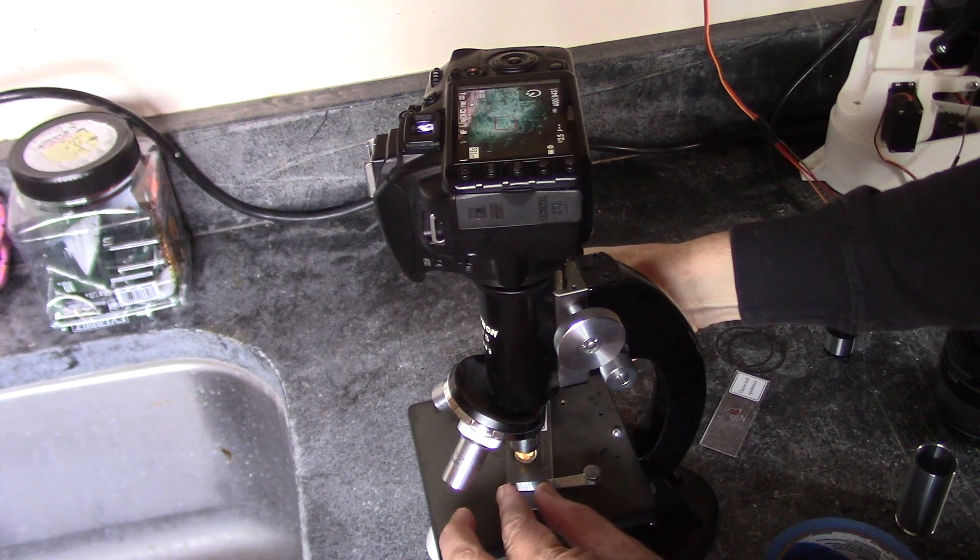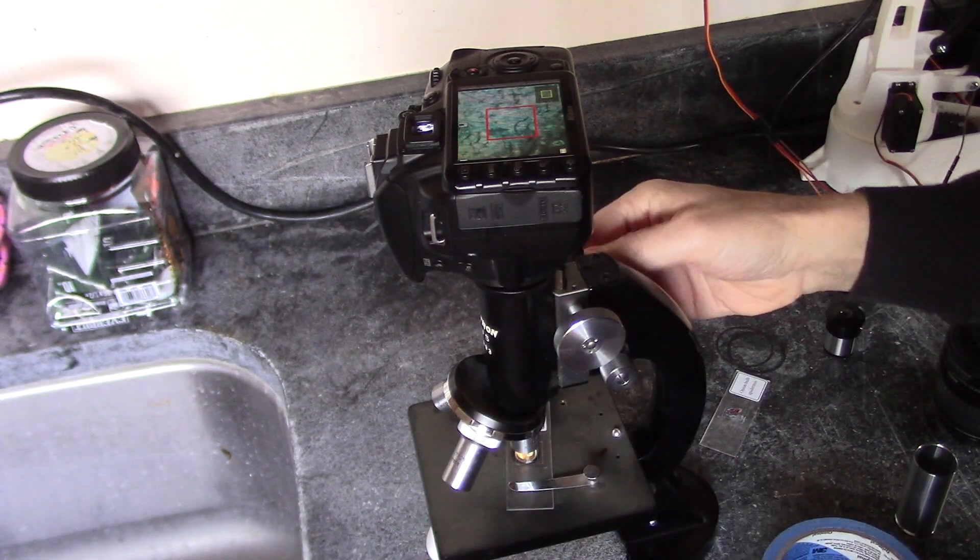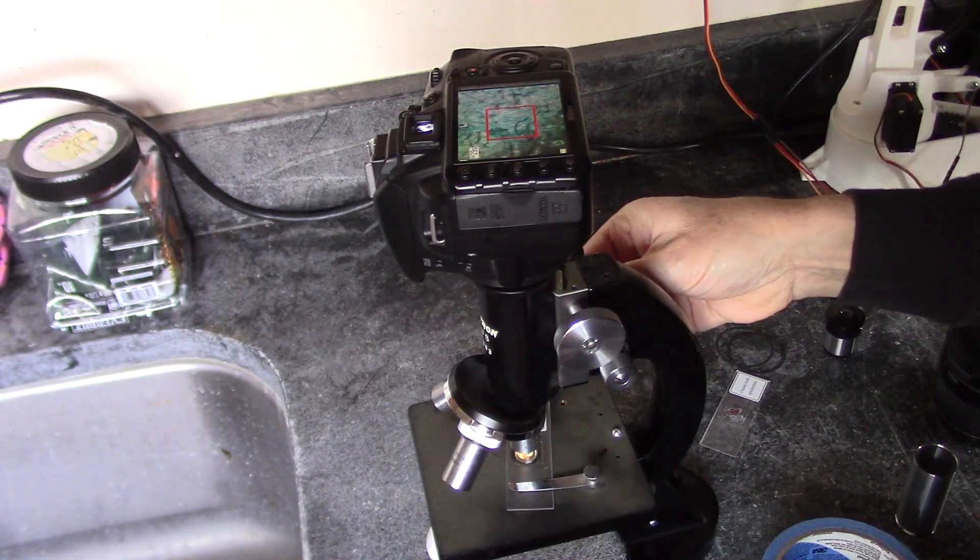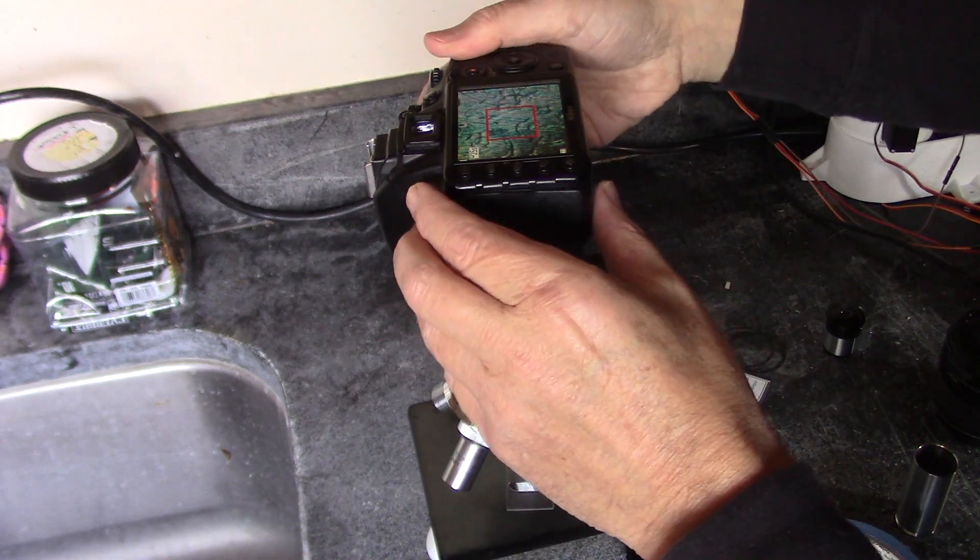Get that underneath there. All right, zoom in a little bit, check our focus. All right, let's try that.